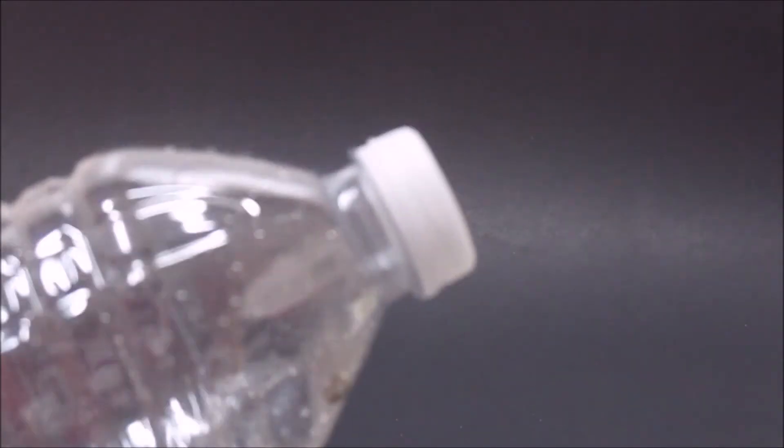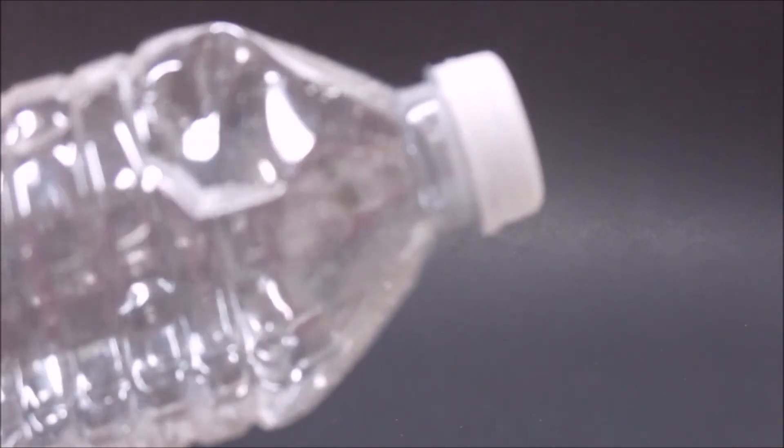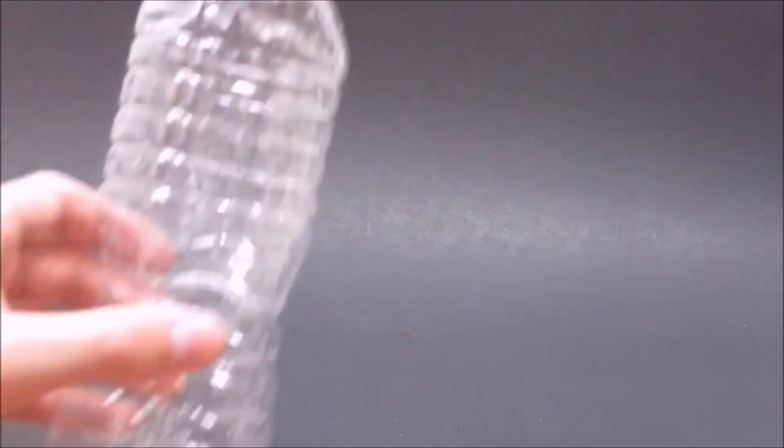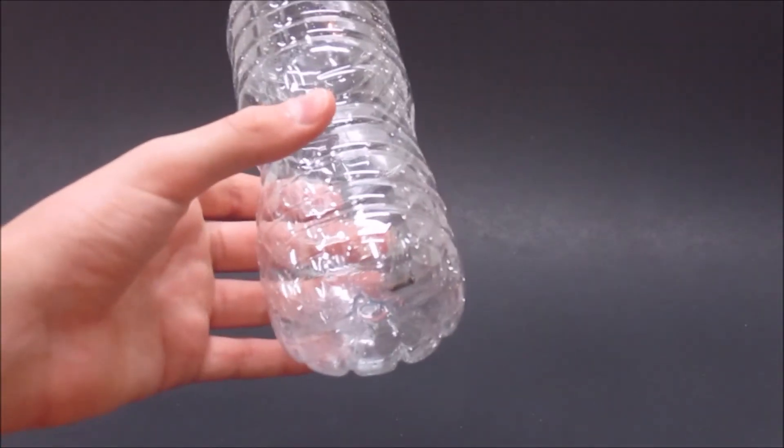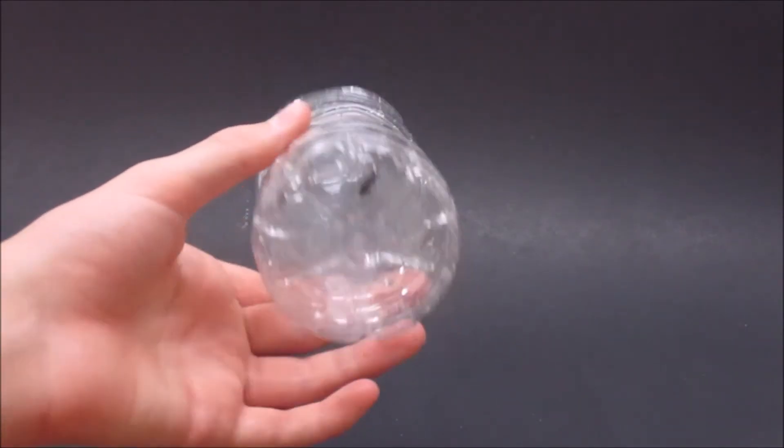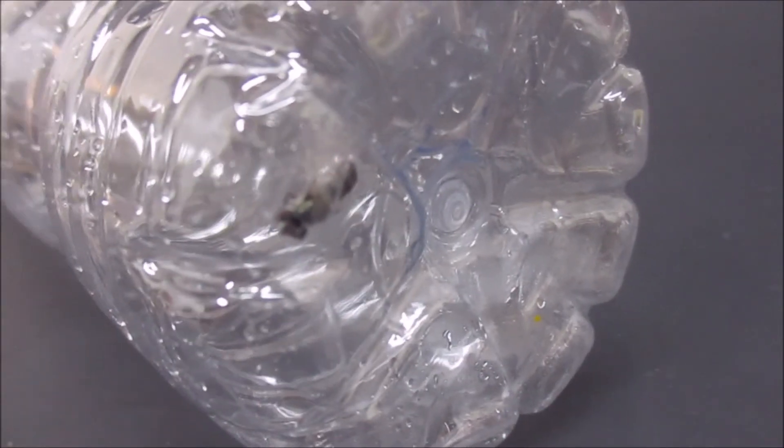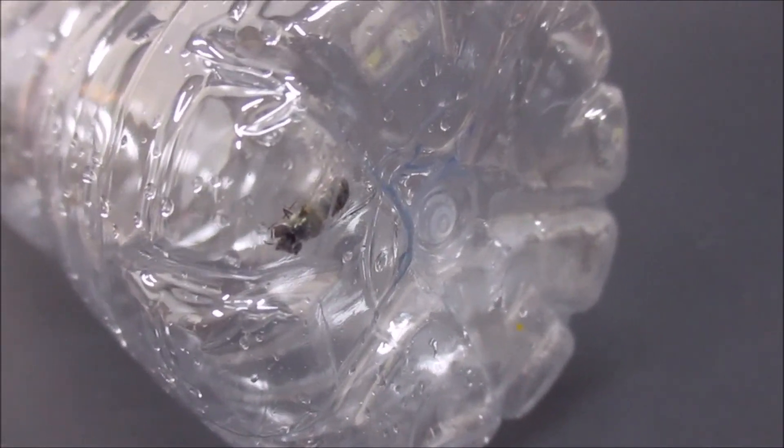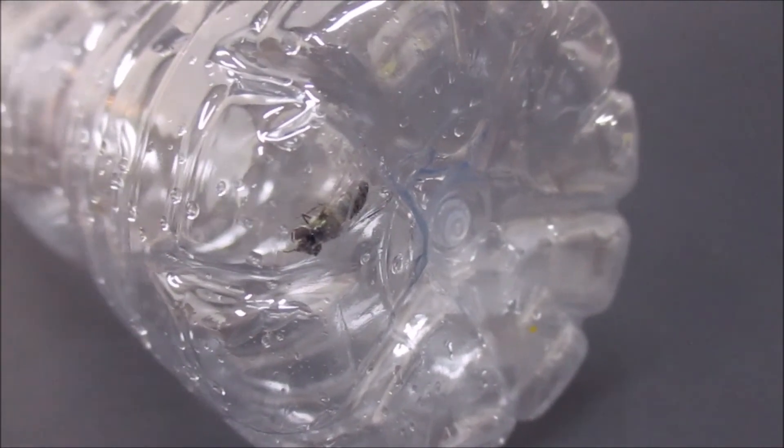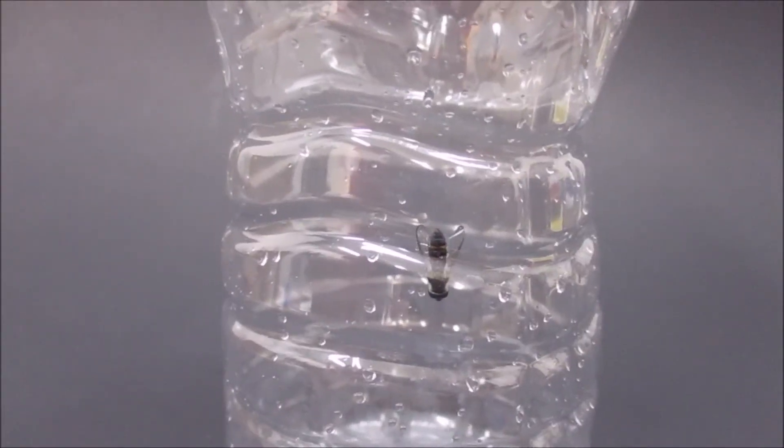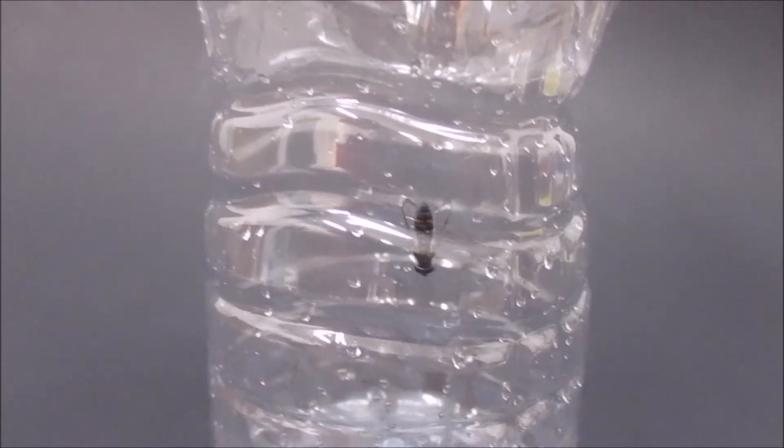After a little while later, the bug was already moving even less. A short while later, he was still moving even less. Here is the bug when the chloroform had taken its full effect.